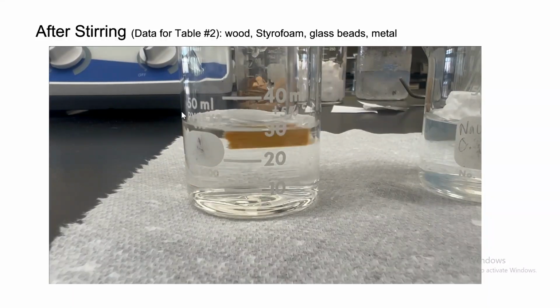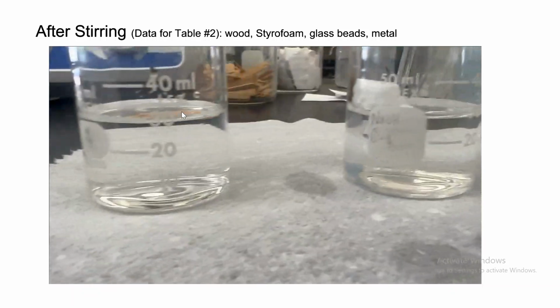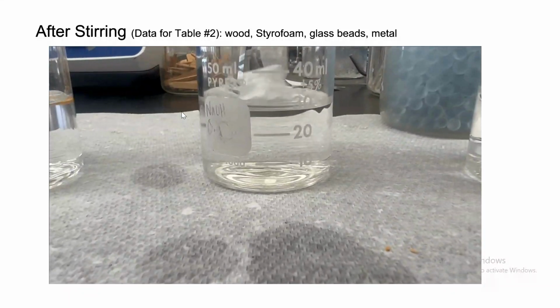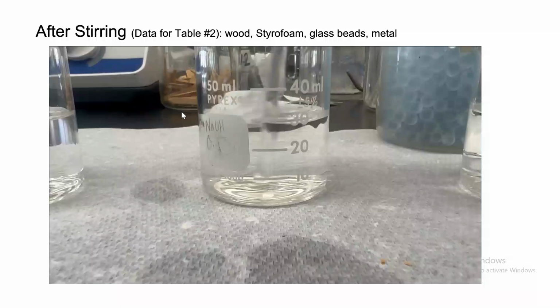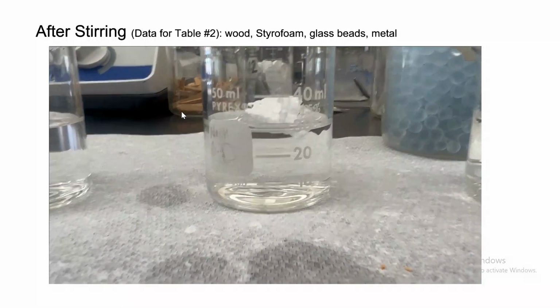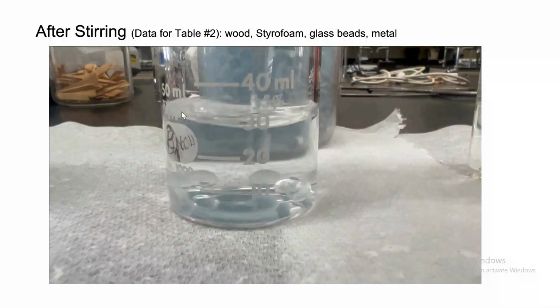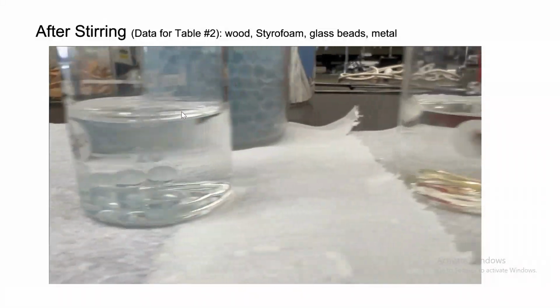All right. So we're trying to stir wood. Now, does wood dissolve in water? And the answer is no. What about styrofoam? Does it dissolve in water? And the answer is no. So you're going to write does not dissolve for observation. Let's look at glass. Does glass dissolve in water? No, it does not. So you're going to write does not dissolve.